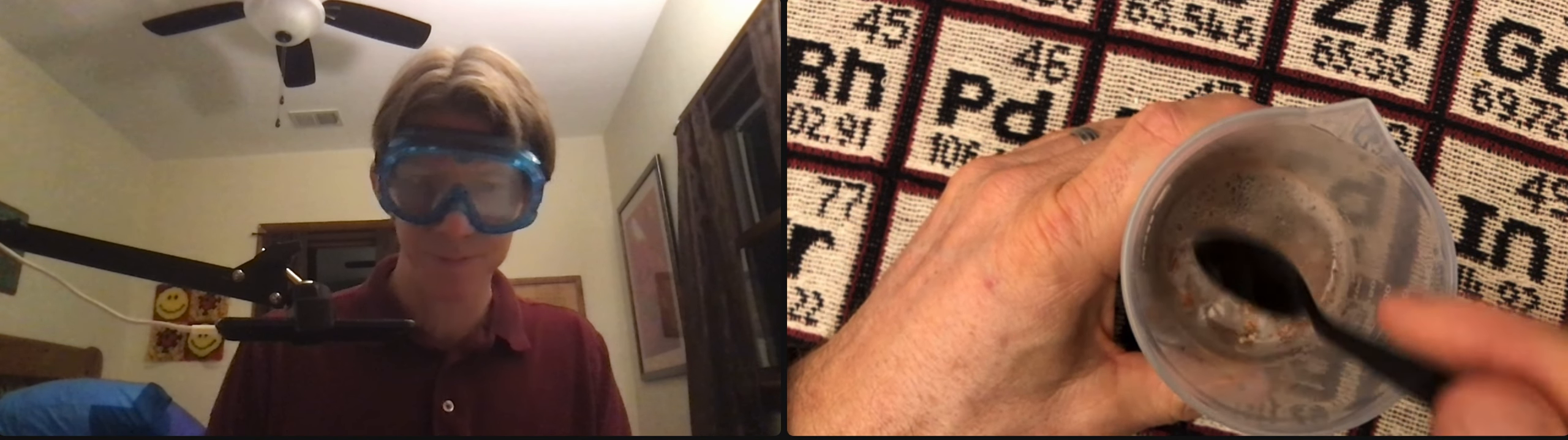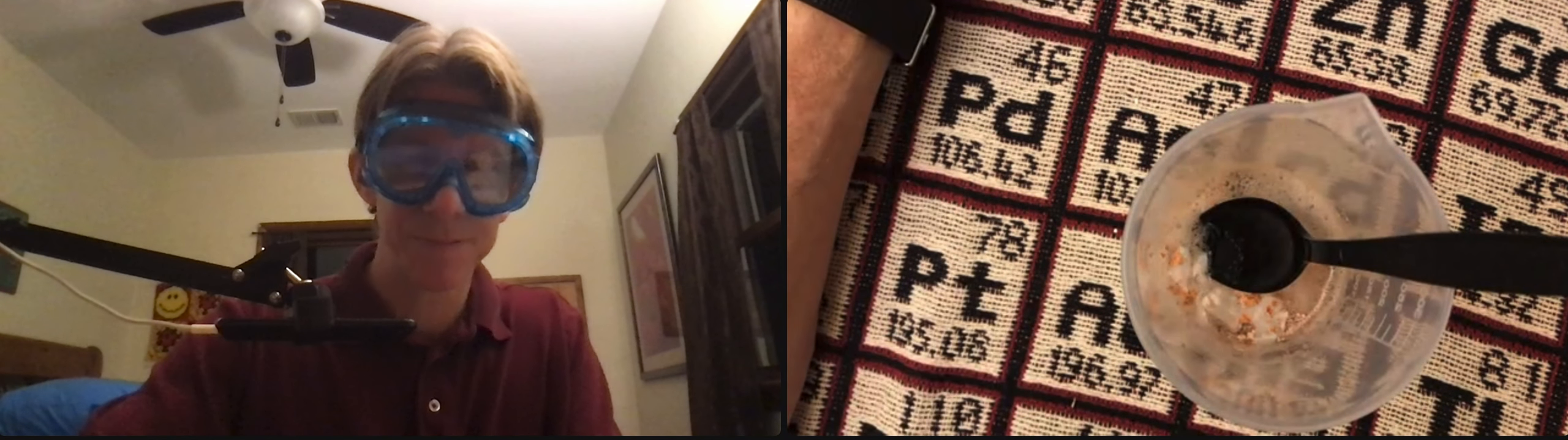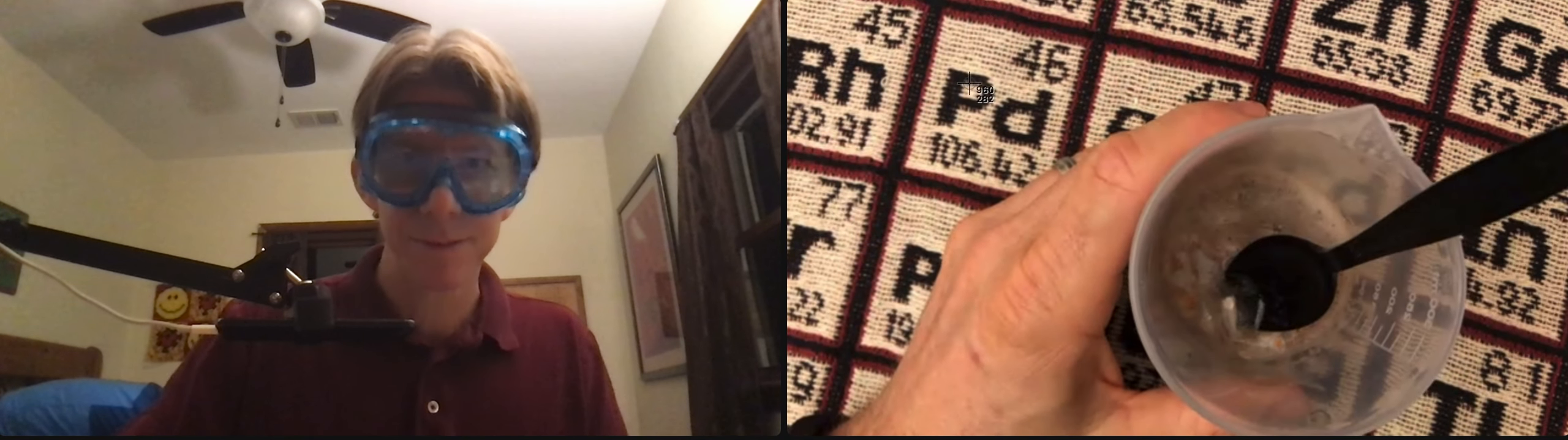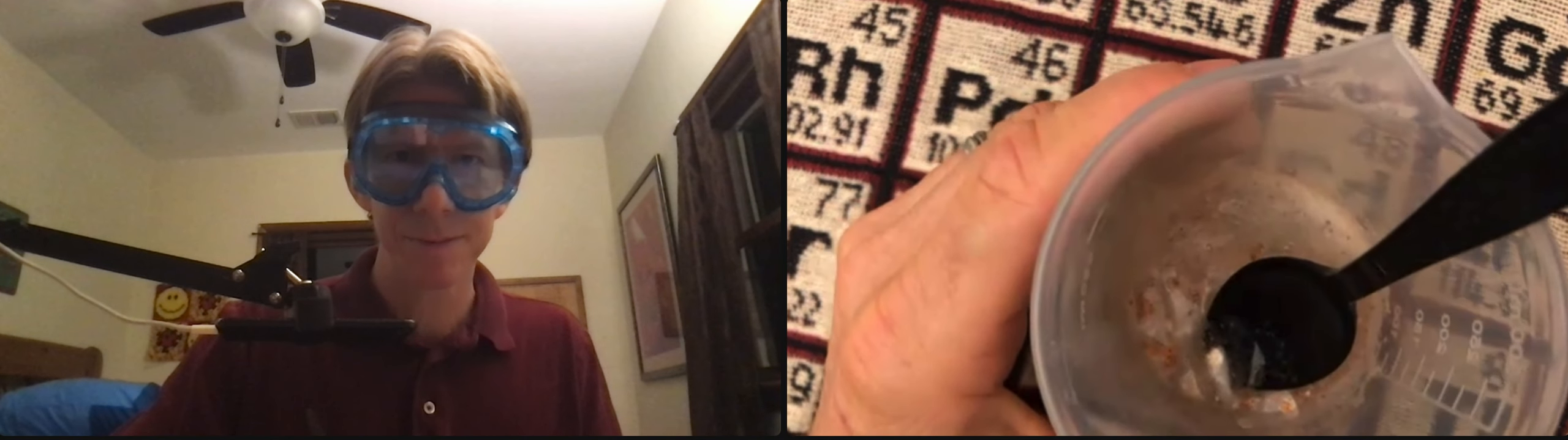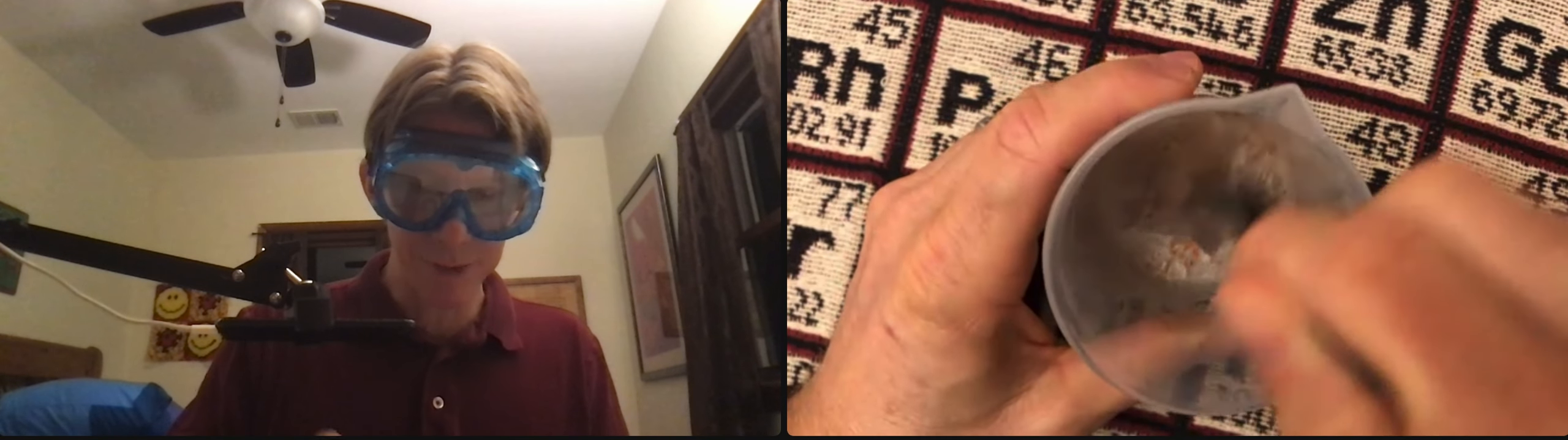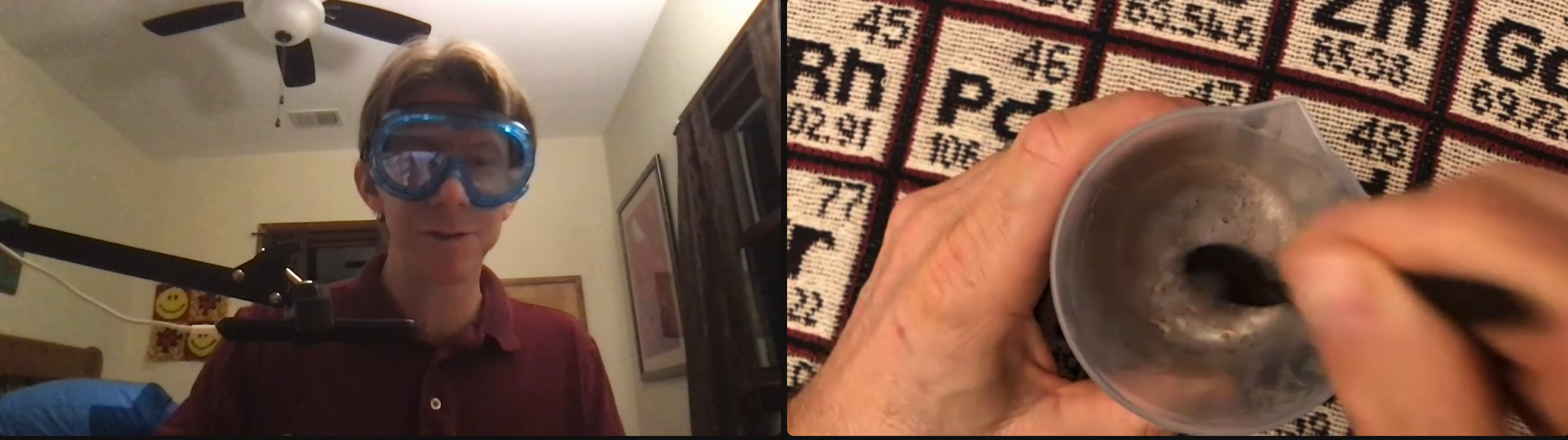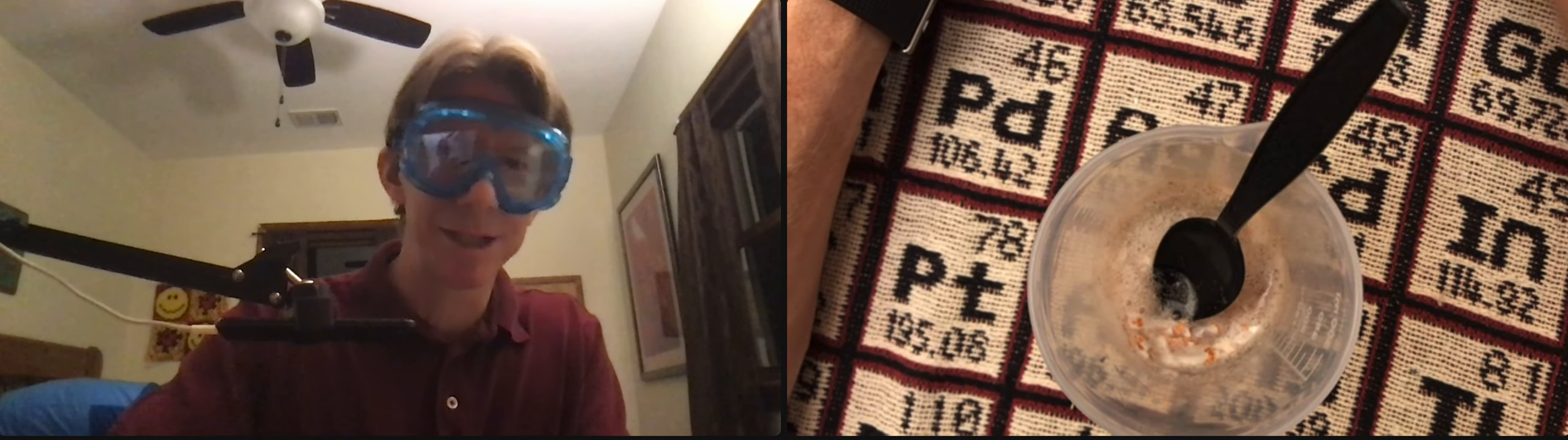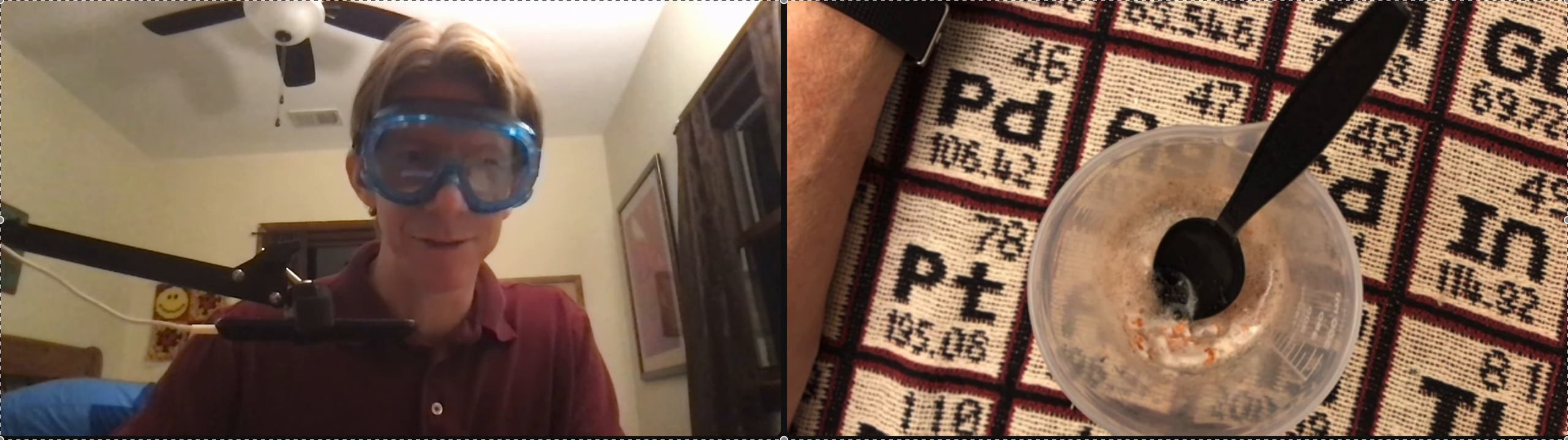That'd be a great picture. I can do this. There we go. I'm going to keep doing it for five minutes, but no need for you to watch or take your time doing it yourself. That's a great picture of yourself.